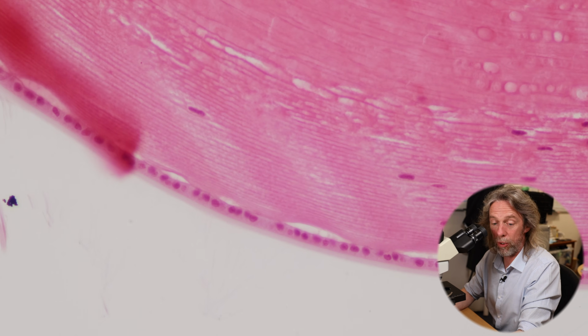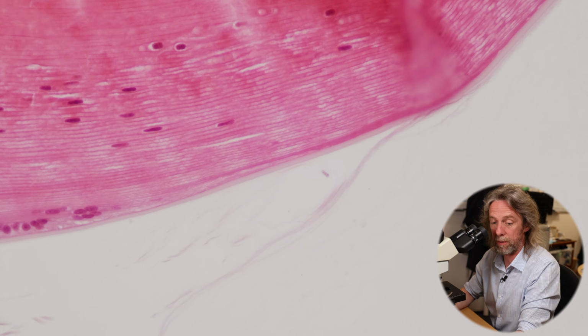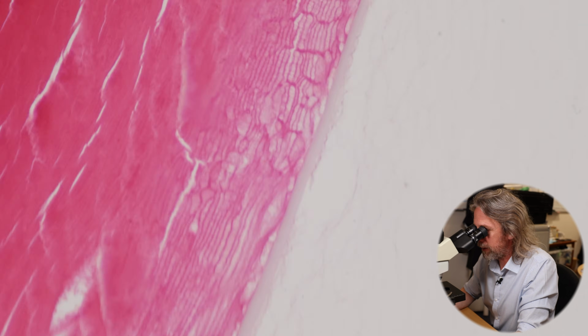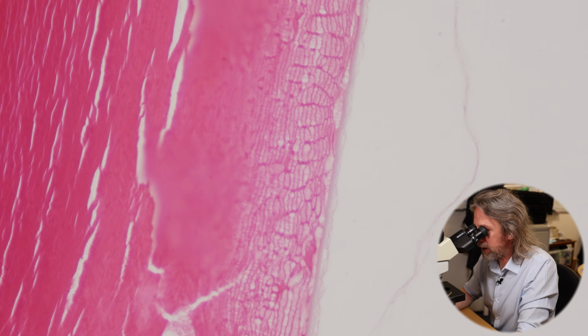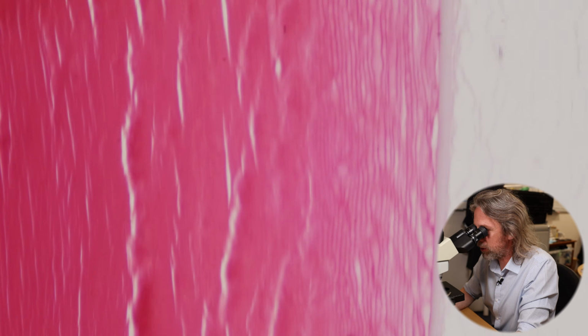So we're now looking at the bottom edge. Well, we're looking at the side of the lens, and we find that epithelium at the side of the lens, and then it stops. Look, there isn't an epithelium on the posterior surface of the lens, but we've still got that capsule, and it's even getting thicker. But I haven't got many eye sections, and I think this is the best one. But look at that weird structure in there. Isn't that cool?